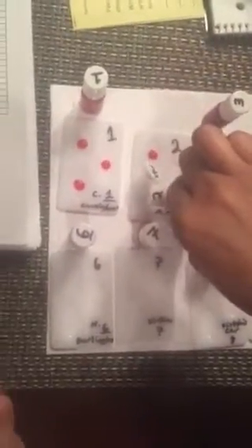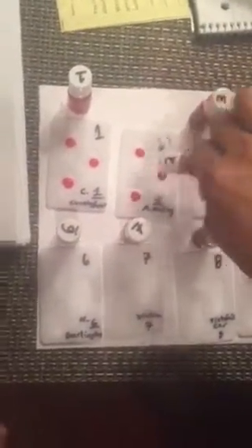And then do the same. Then you want to go for 2. 2 is M. Malloy. Slowly squeeze. 1 drop of M. Malloy there. You and your group are going to split up the work to make sure that you drop each of the corresponding numbers and blood samples into each well.